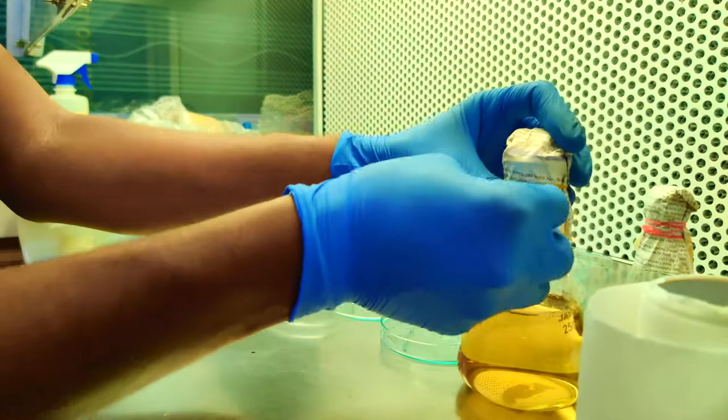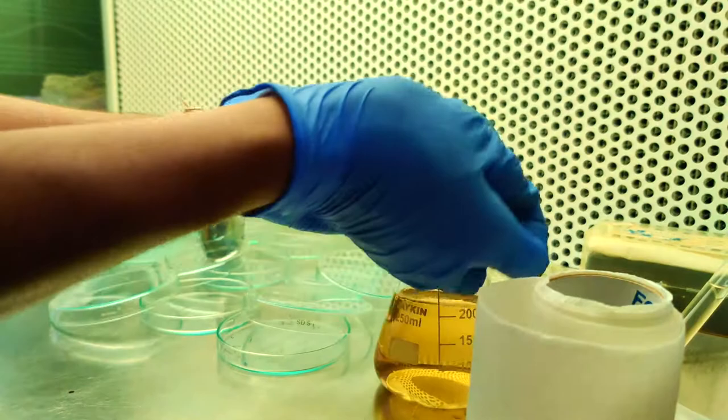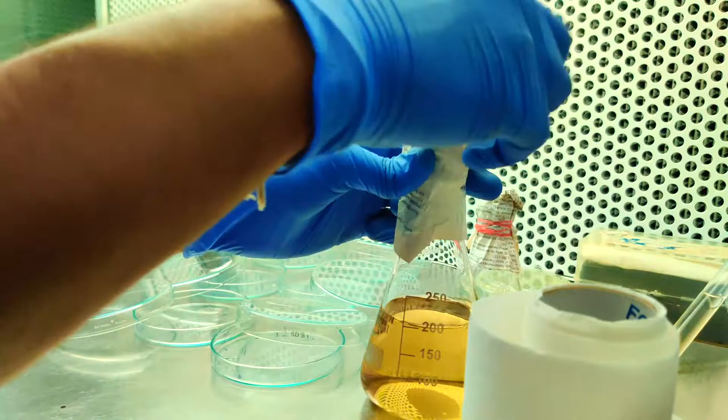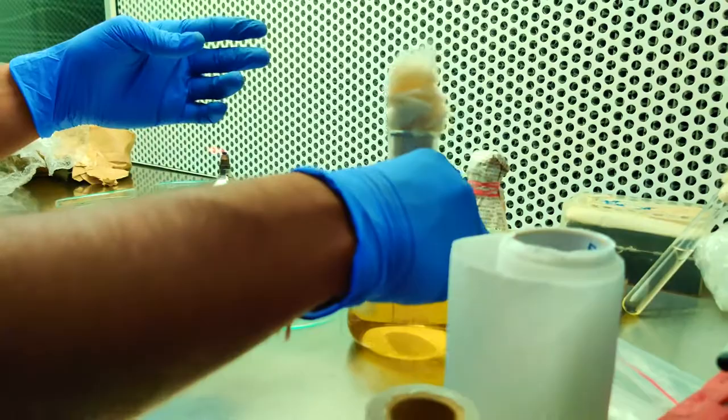Remove the top rubber band. See how tight we have made it. That is how we should make to prevent any water vapor entering. This is the paper how we wrapped, so after wrapping we just rubber banded it.